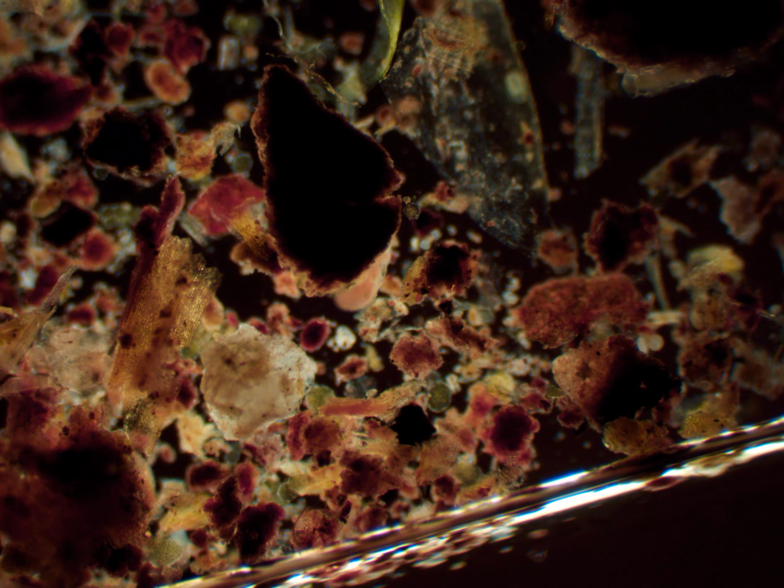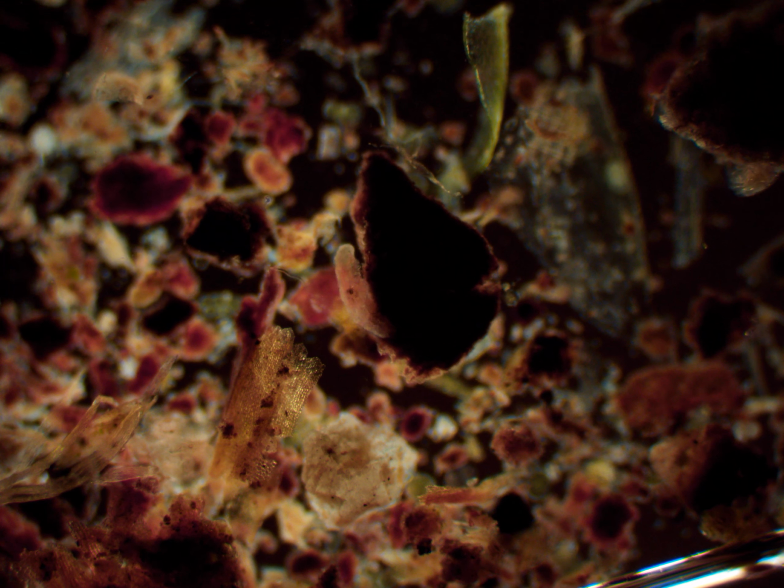And here it is in darkfield again. You can see it swimming around with that rotifer next to it, but you can see a lot of different colors and different contrast now in darkfield. You can see it climbing around that piece of sediment.